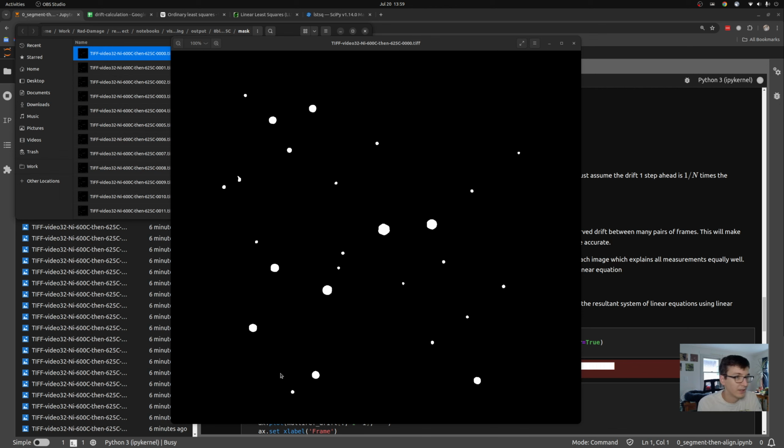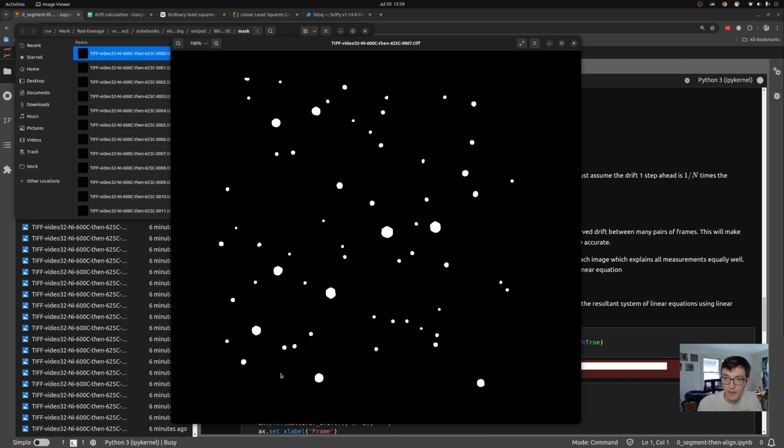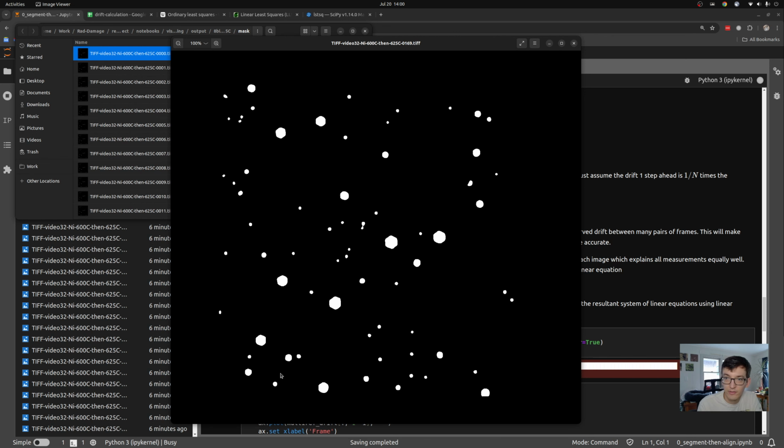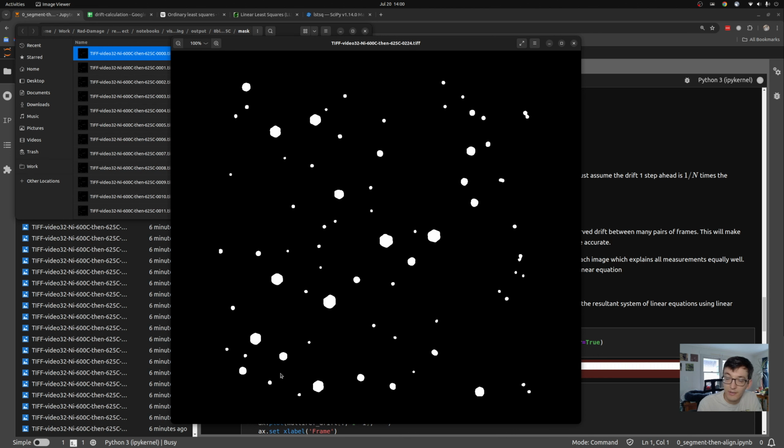I don't have the actual microscopy image on hand, but what I have here is a mask showing white regions where a machine learning model that we created detected a void in the material. And I have these over the course of time. And we'll scroll through a bunch. You'll note here that the voids, their position towards each other does stay relatively constant.